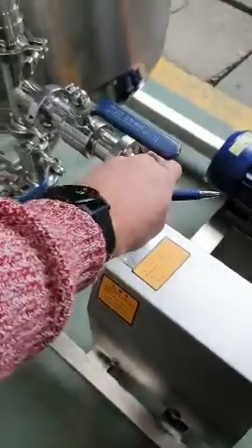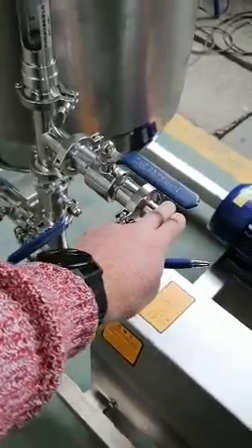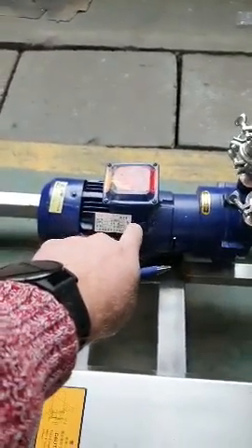The centrifuge connects here — this has all your pressure gauges and everything you need. The ethanol from the centrifuge goes into your receptacle, comes out, and into your falling film. It goes inside here using negative pressure from your pump, which pulls negative pressure all the way back into the machine. The liquid goes in at the top.